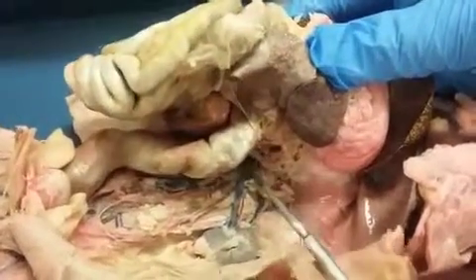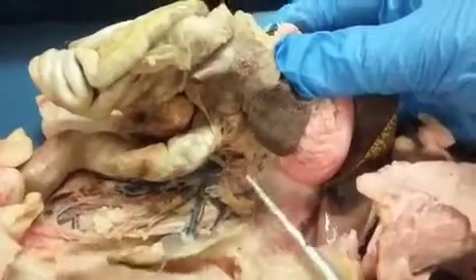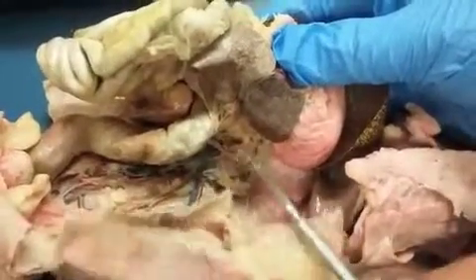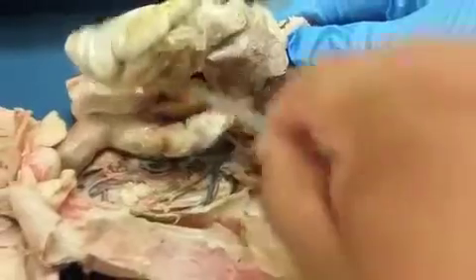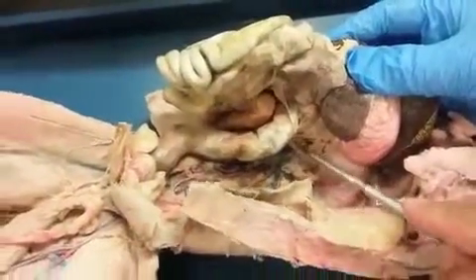Looks like it's in there. It'll be clear. You normally see the celiac trunk here going straight up, and then the superior mesenteric coming off at an angle going towards the small intestines. You see how I tug on this and I pull this? Yeah. Right, that's the superior mesenteric. Okay. Right?